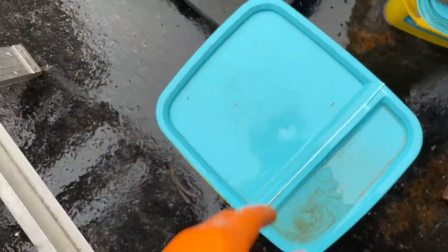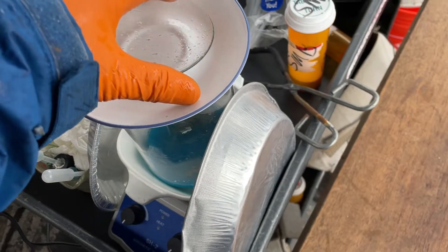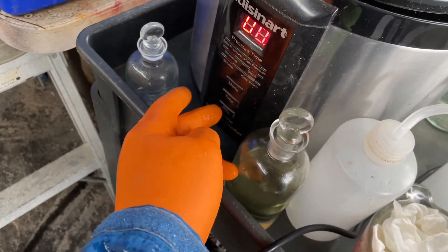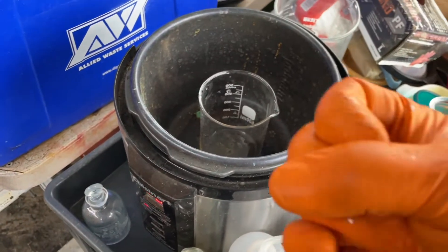Okay, that's it — I'm drying that dude. See what we got. Top off the water. Let it go a couple minutes, it should be dry. That's right, peace baby.